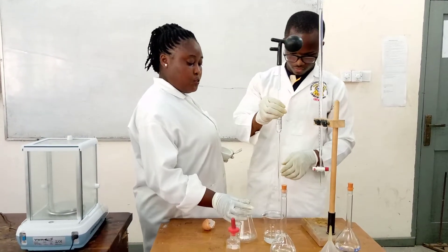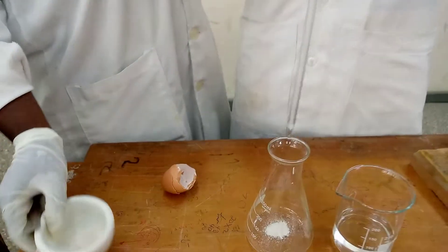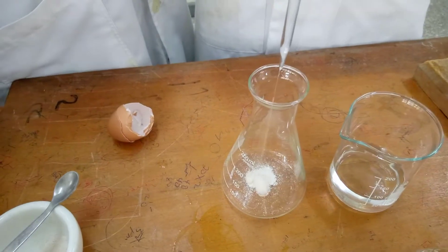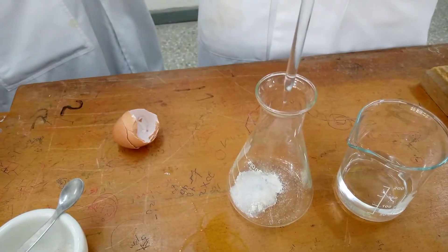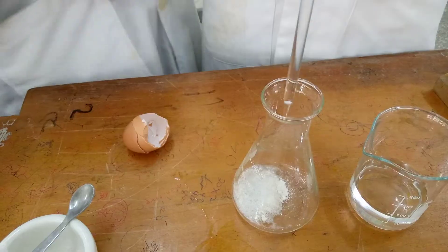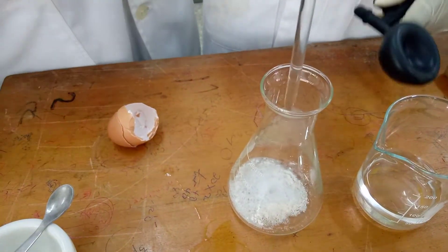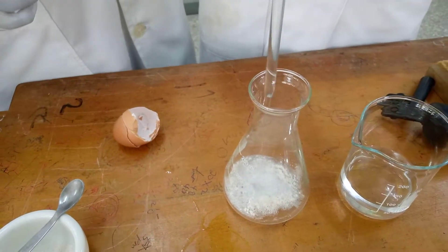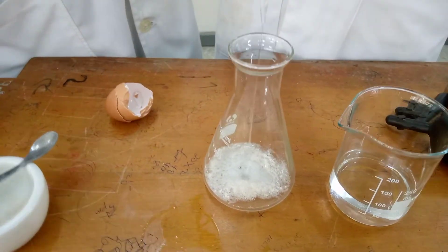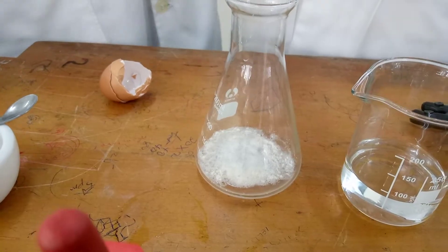I'm done weighing, so Mr. Apia is going to add the acid to the eggshell. Let's see what will happen — yes, a gas is being produced, as we can see. You can see some bubbles coming out as the acid is reacting with the shell.